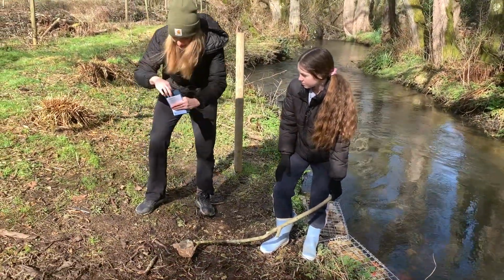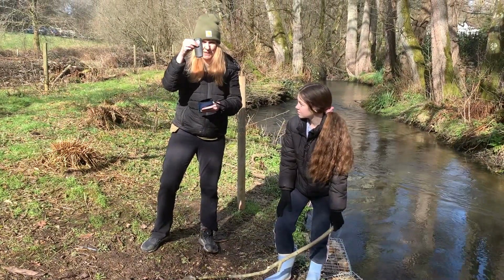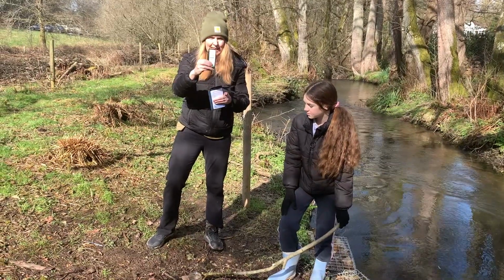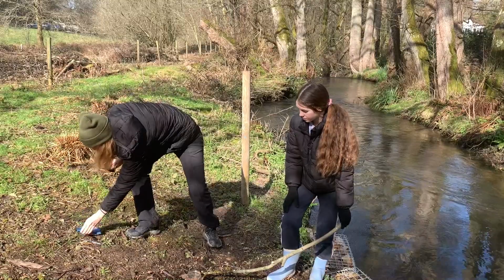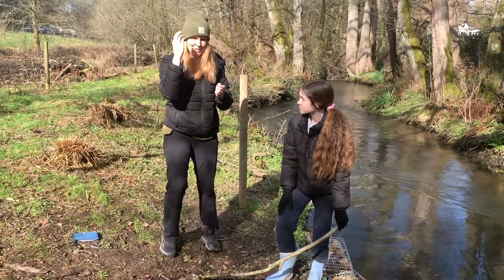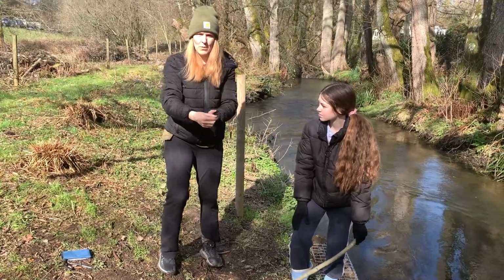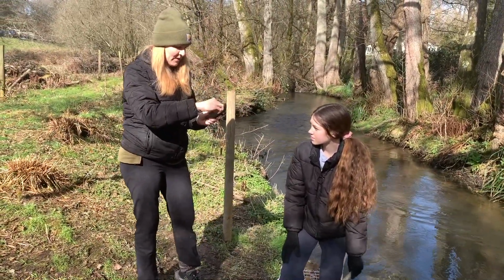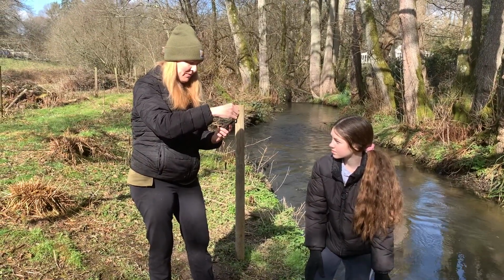Put this up here. Next thing we're going to do is take out our test strip container. You can see that there's a comparison chart on the back here. With dry hands, make sure your hands are dry. You don't want to get any moisture in this container. We're going to open it up, take out 1 strip. Be a bit finicky.